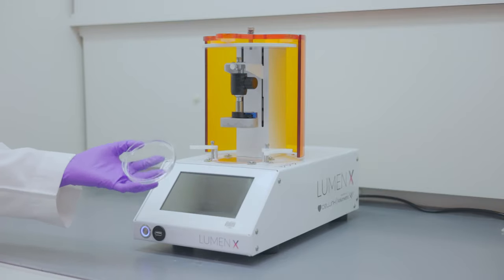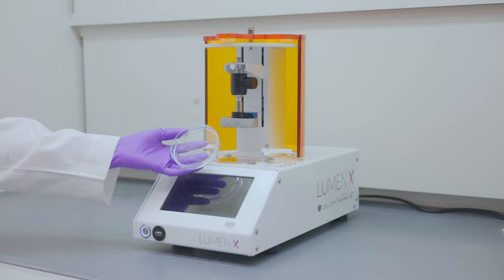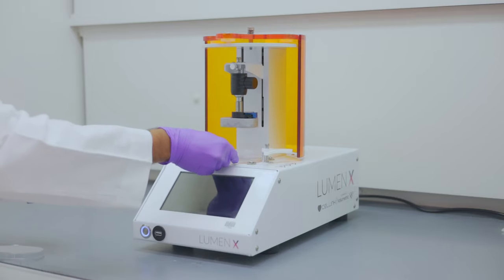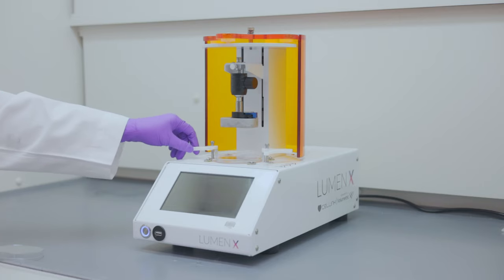This is a PDMS-coated vat. Place the vat over the glass surface and turn these clamps to hold the vat in place.